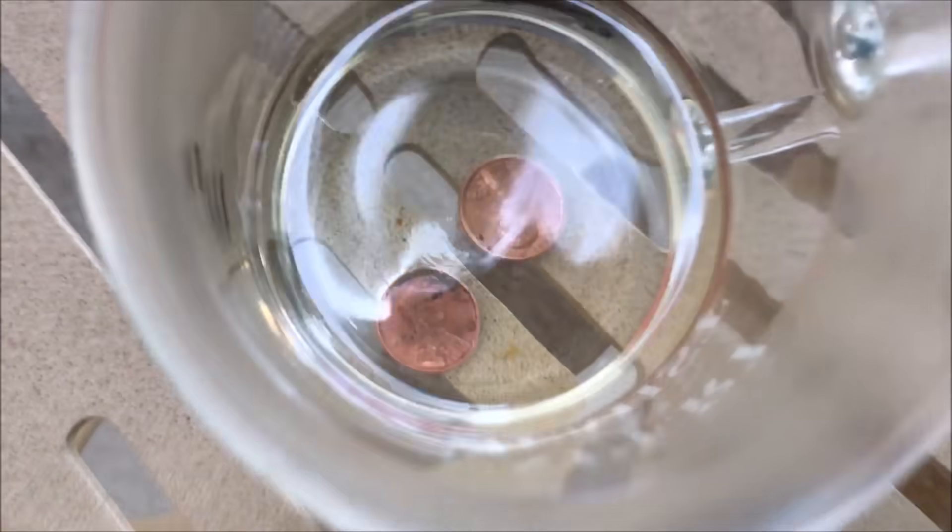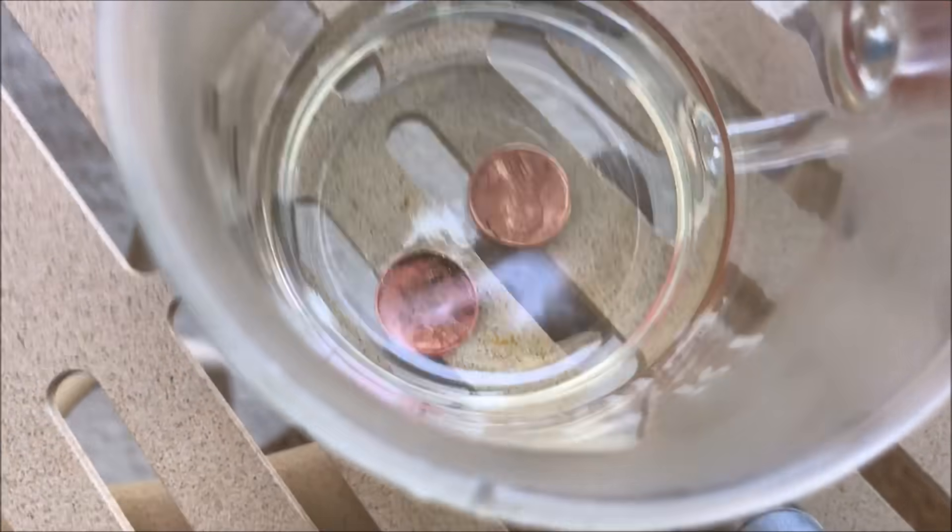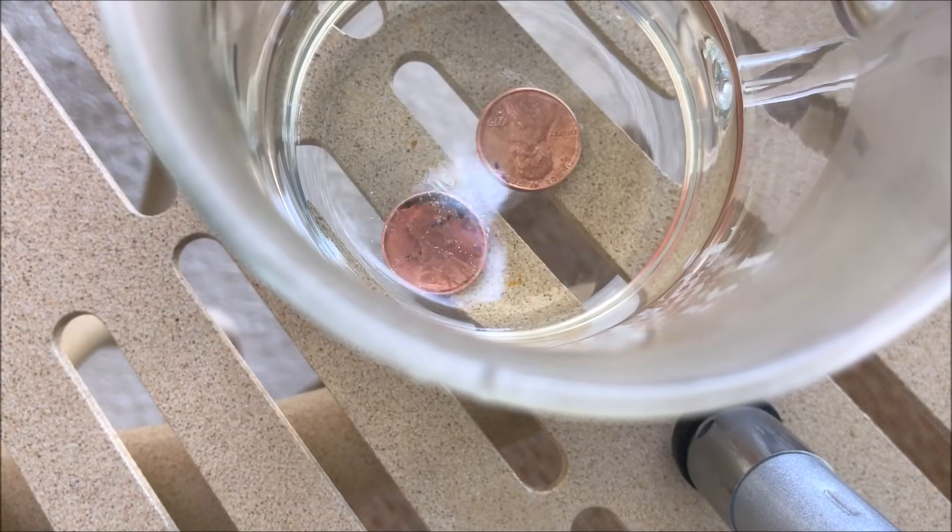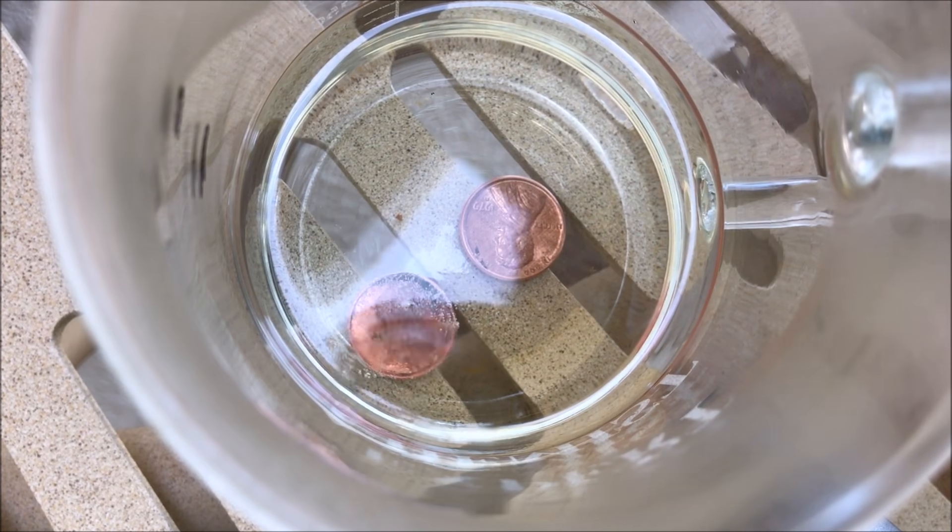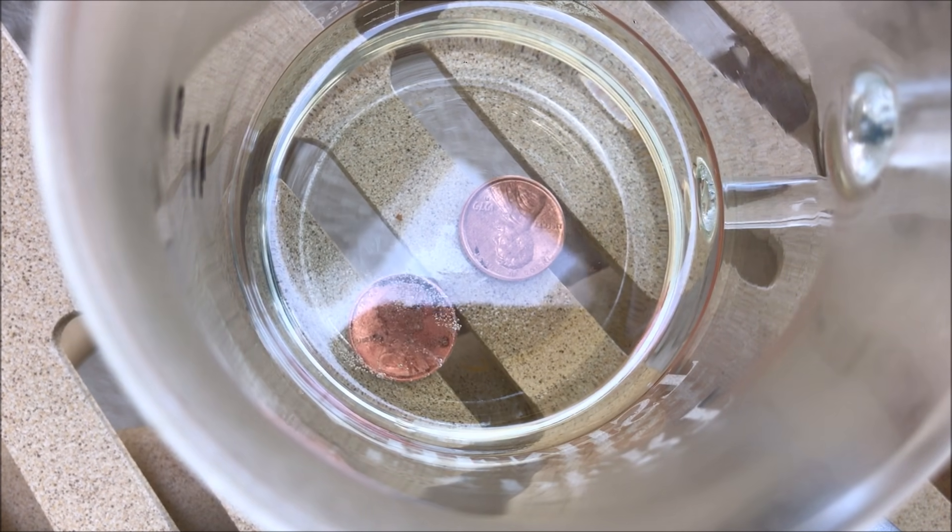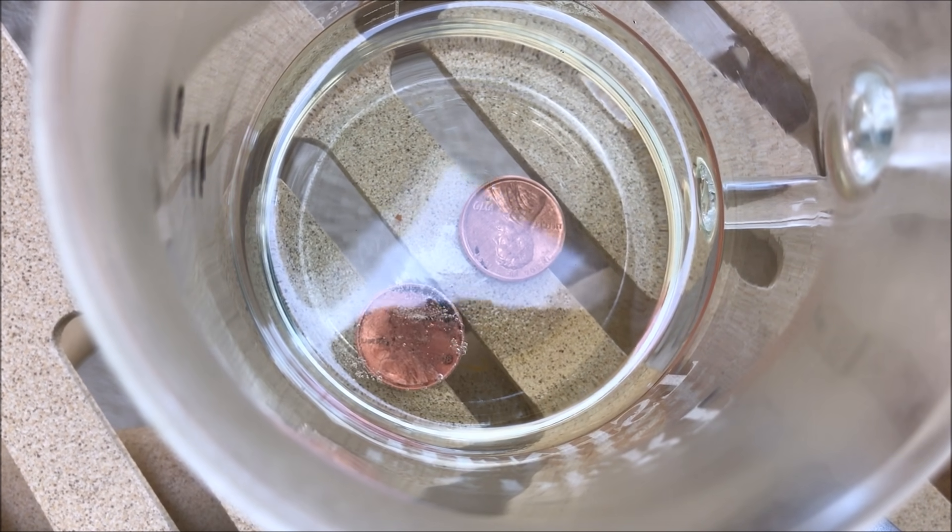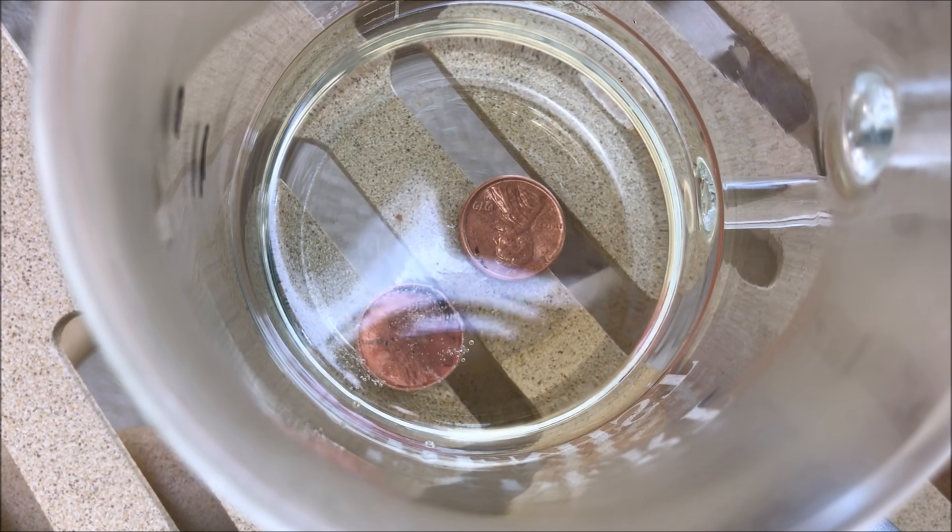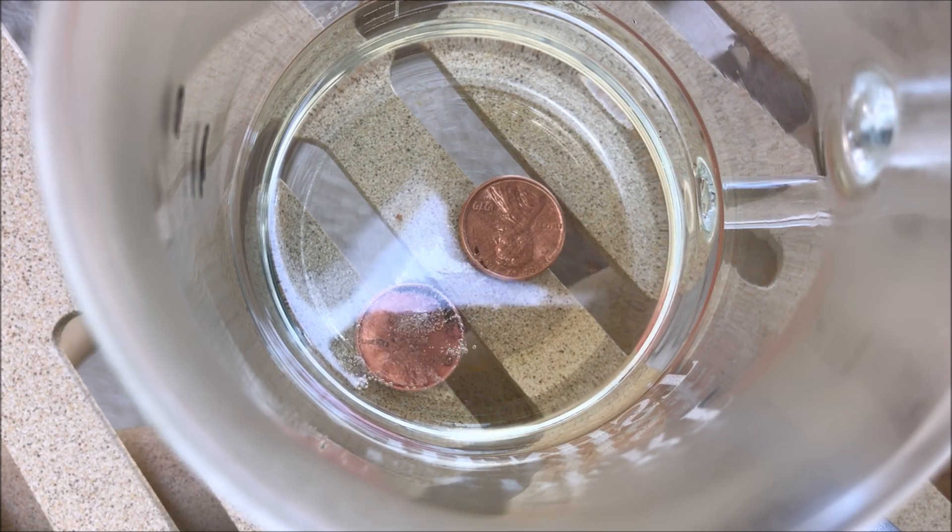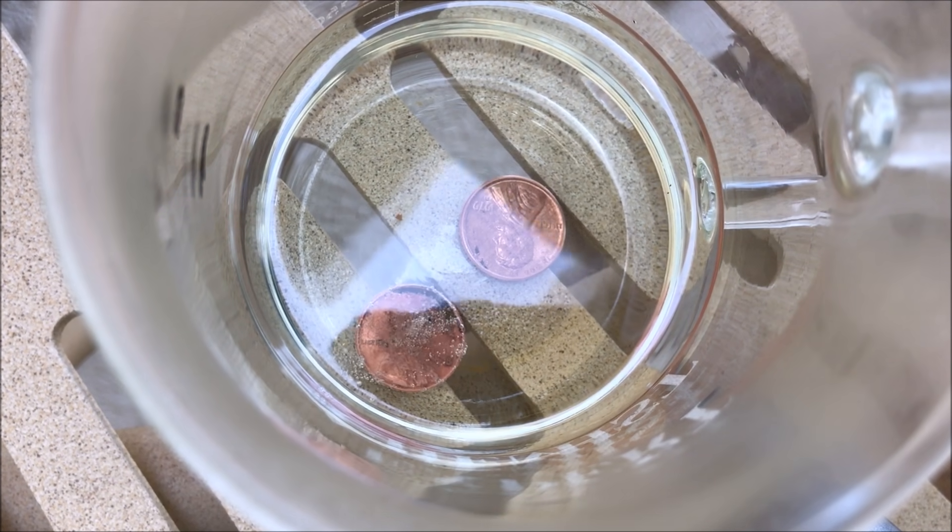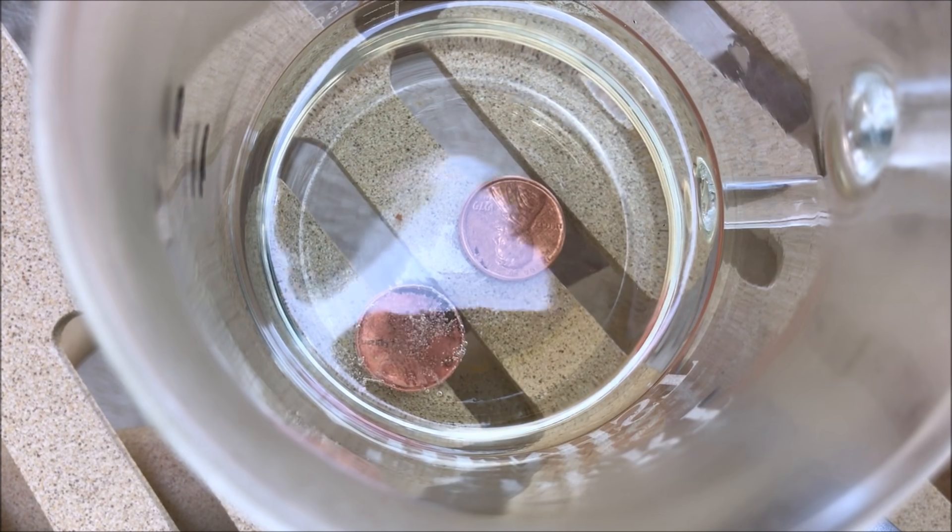Let's try and get them to separate. Right away you can see that they are shiny. And you can see the hydrogen gas being given off by the one that is made out of copper and zinc. And you can actually see the zinc from the scratch and you can tell that it is reacting.